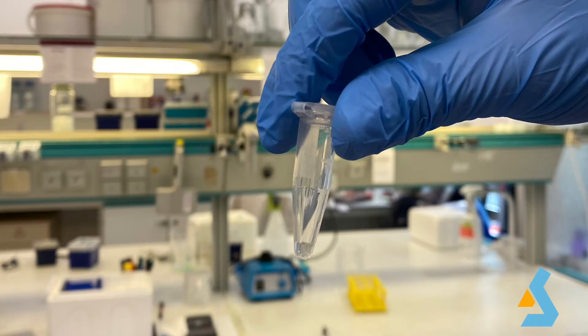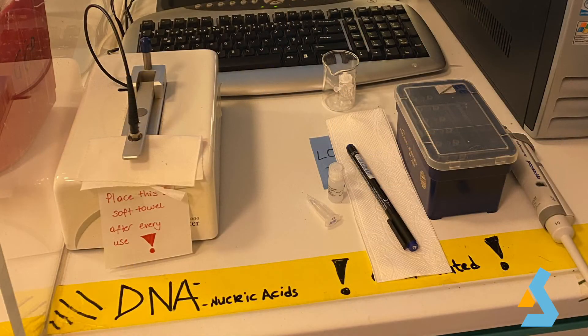Now, the purified plasmid DNA is ready for immediate use in all molecular biology procedures such as conventional digestion with restriction enzymes, PCR, transformation, sequencing. However, we need to know the concentration of plasmid DNA using a spectrophotometer, in this case a nanodrop.